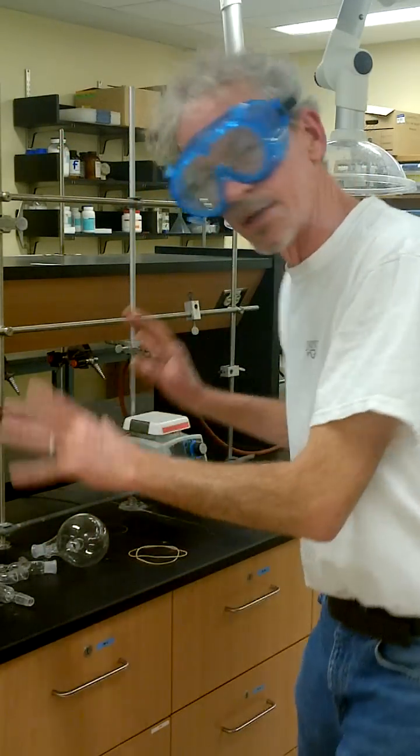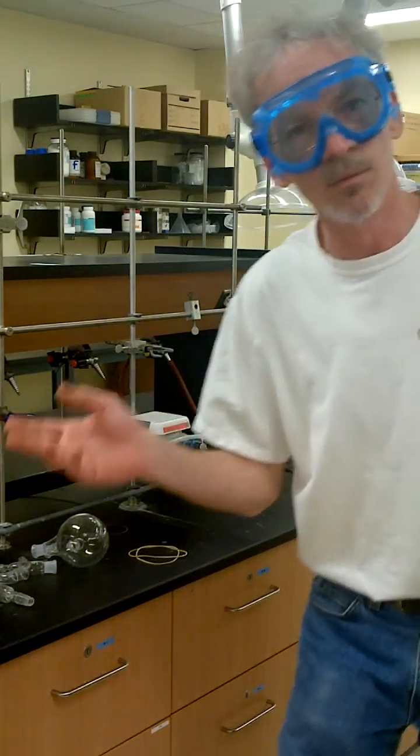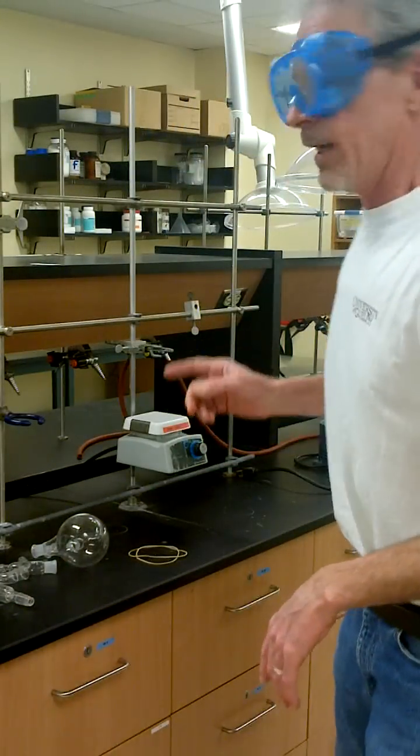Welcome back to the Organic Chemistry Laboratory at the University of Guelph, Chemistry 2700. Experiment two, the steam distillation of cloves and extraction of the essential oils. Very tricky to set up. We've got a lot of expensive equipment here, so we have to figure it out. We have to put it together. You have pictures, you have instructions, but sometimes the video is better. So here we go.